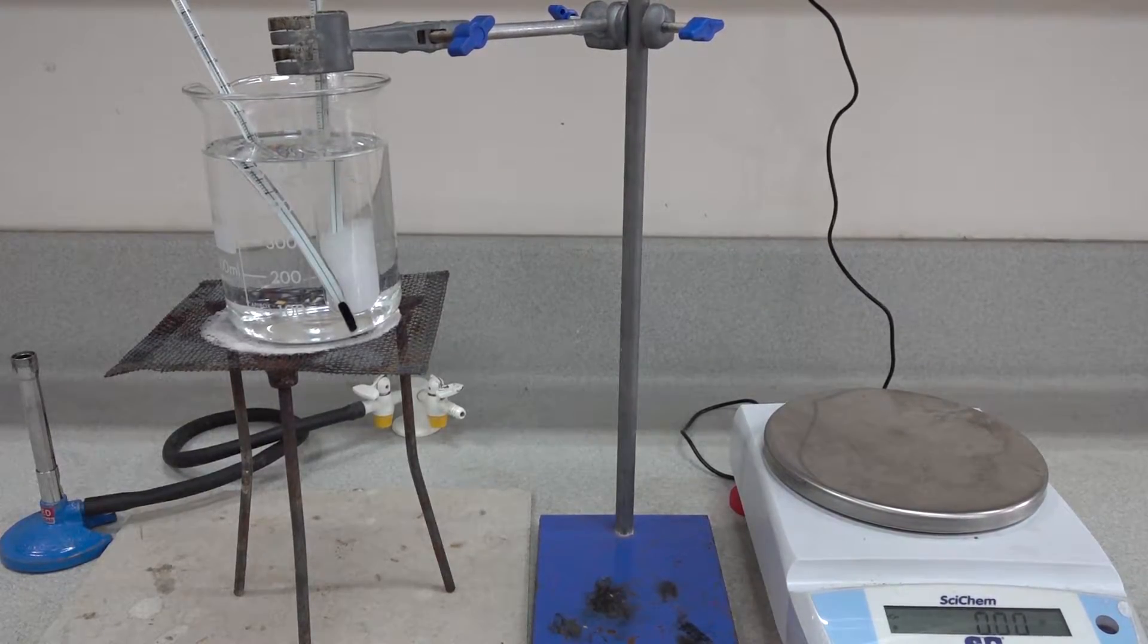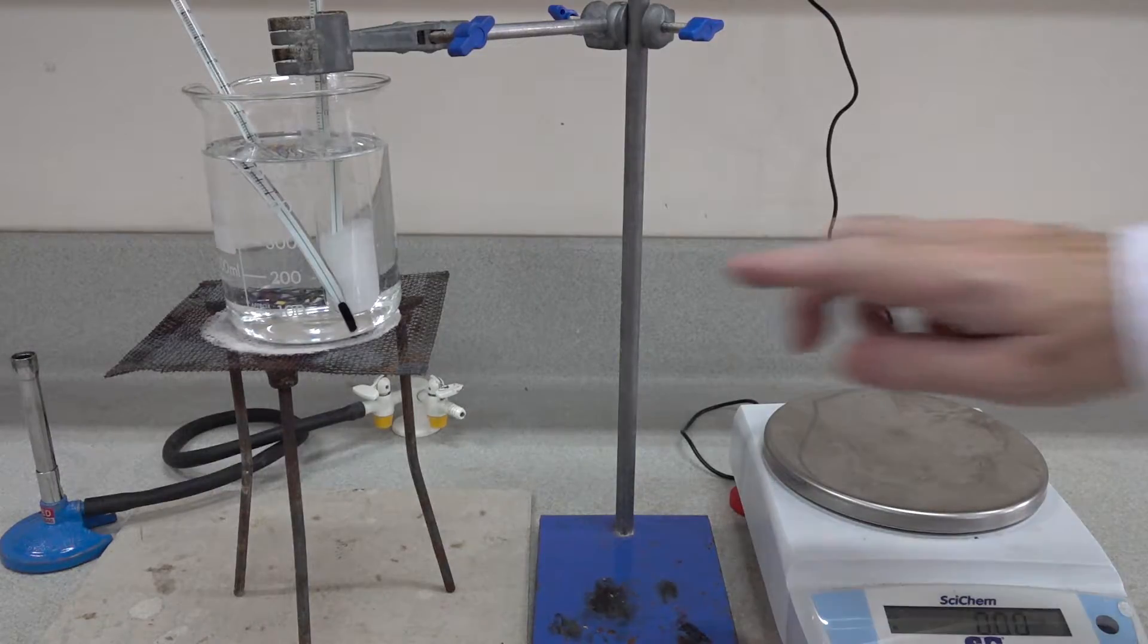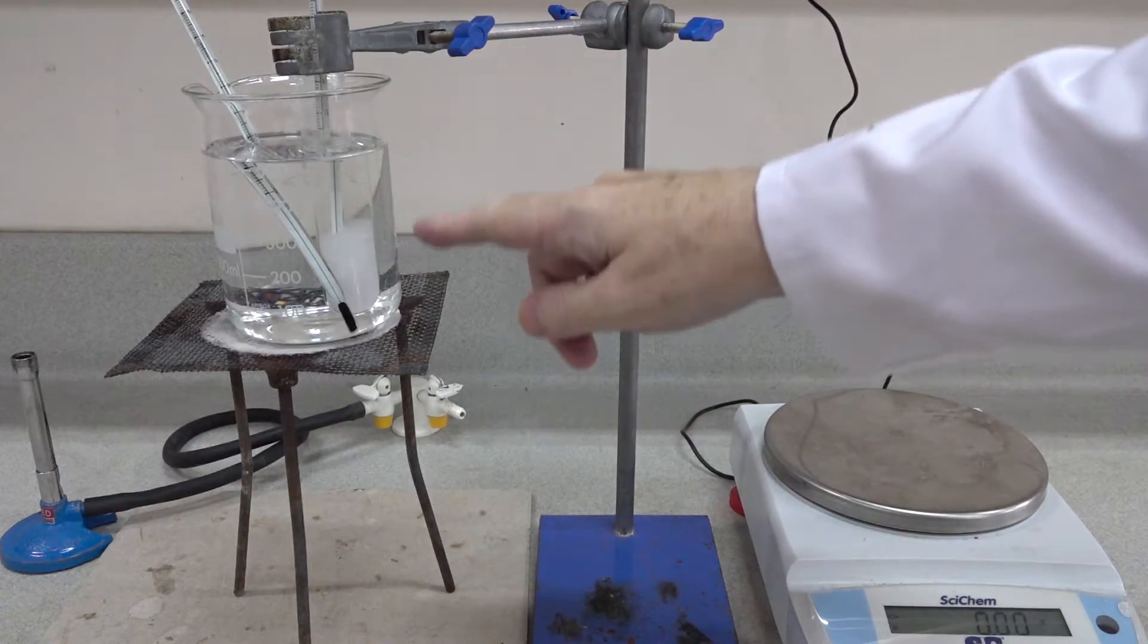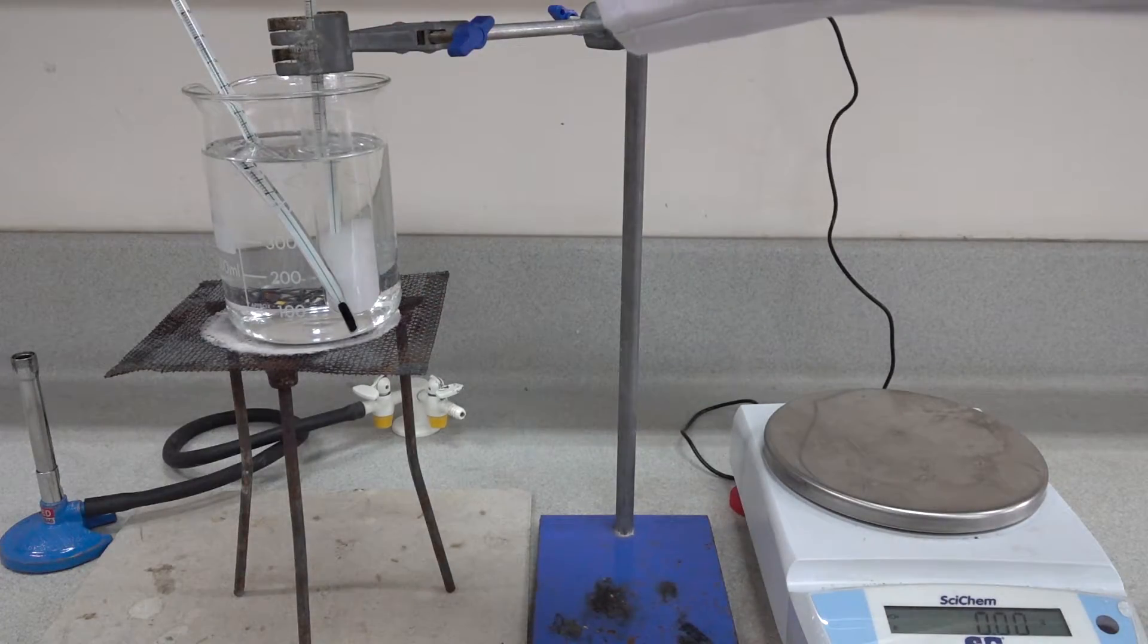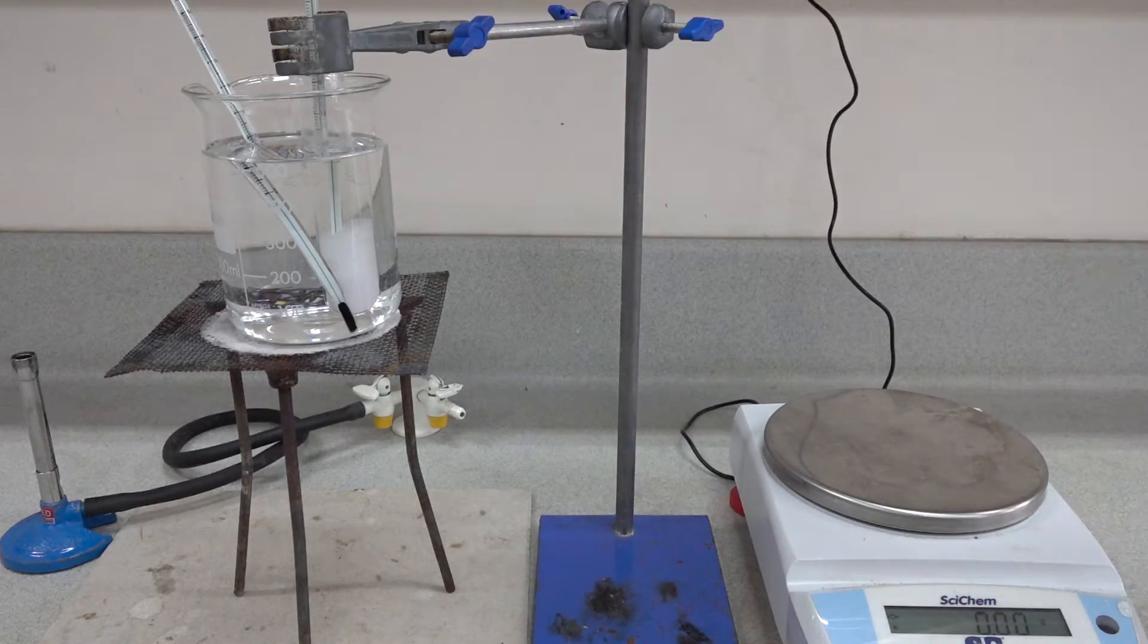An experiment to determine the solubility of potassium nitrate at a specific temperature. If you've got time to set this up slowly, it's far better if you set up a water bath as we see here. We've got potassium nitrate and a saturated solution which is just at 40 degrees centigrade in the boiling tube in the middle.